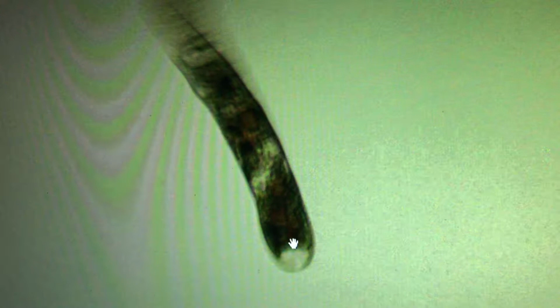A little better view of the contents within the cytoplasm. The head is out of focus, but you can see the bottom here, and you can see all the zooxanthella that are still being digested. It looks like the digestion of the zooxanthella occurs as they move towards the back of the parasite. And if I had to guess, I would say these vacuoles, or cytoplasmic clear sacs, are probably digestive sacs. They probably either fuse with the zooxanthella or somehow connect or engulf the zooxanthella and cause it to be digested.